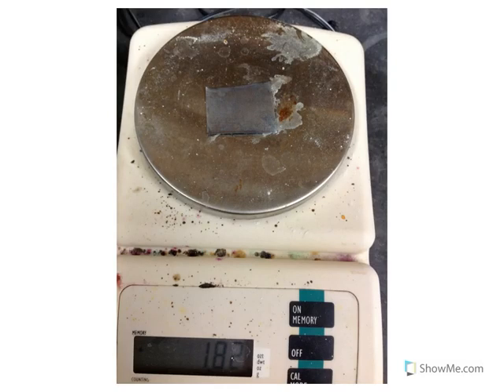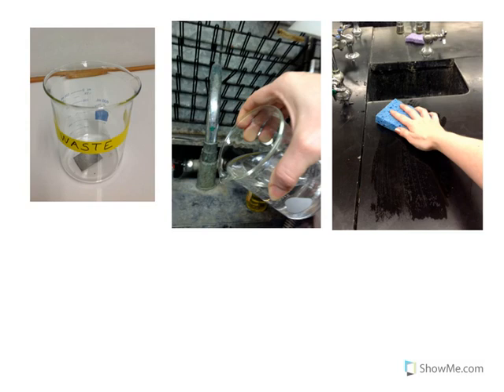Hopefully, if all goes well, the mass will have decreased, not increased. Place the used piece of metal in the waste container provided and pour the diluted acid down the drain. If time permits, repeat steps one through eight with a second piece of galvanized iron.